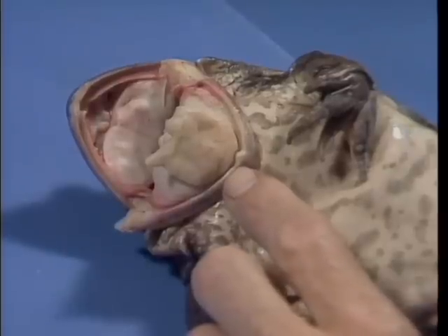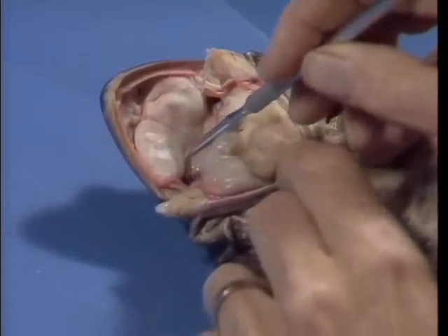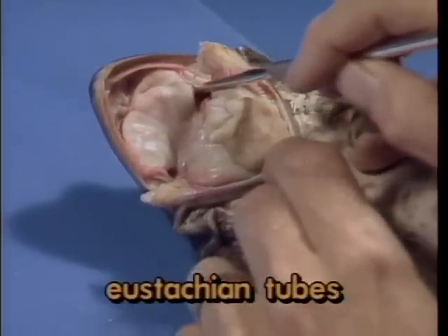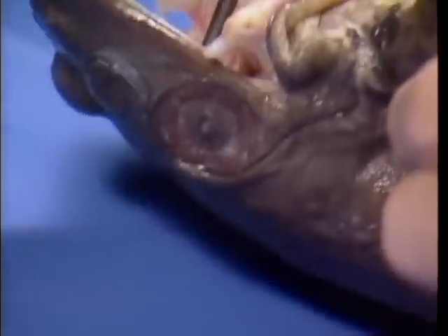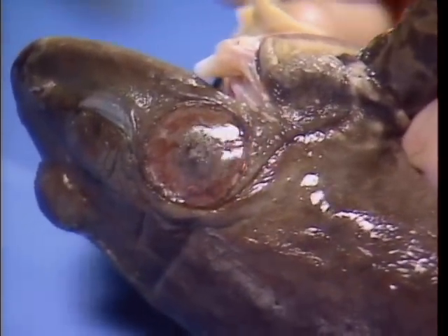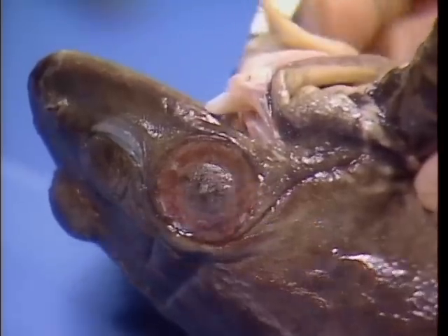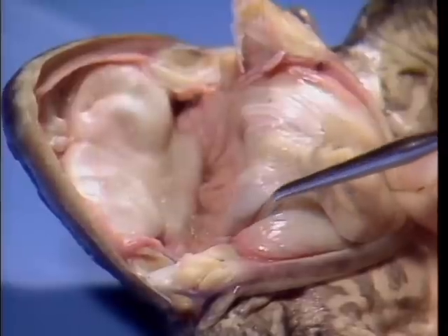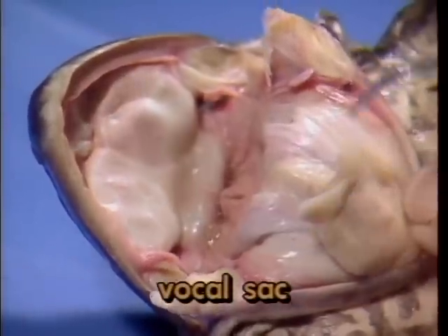Lateral to the esophagus are openings on either side of the mouth cavity, here and here, which mark the entrance to the eustachian tubes. Each one connects to a middle ear cavity. These tubes aid in balancing the air pressure on either side of the tympanum, much as they do in humans. If your specimen is a male, it will contain an additional pair of openings just lateral to the eustachian tubes. Each opening leads into a vocal sac.